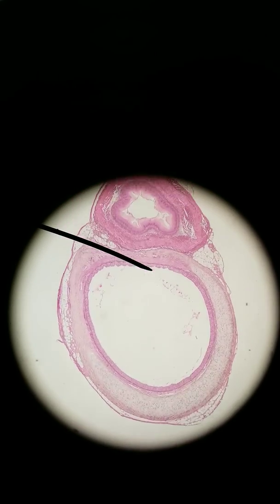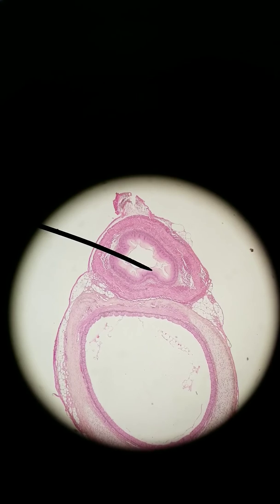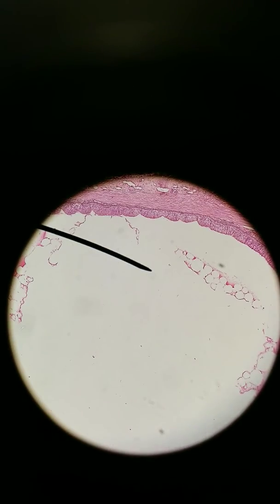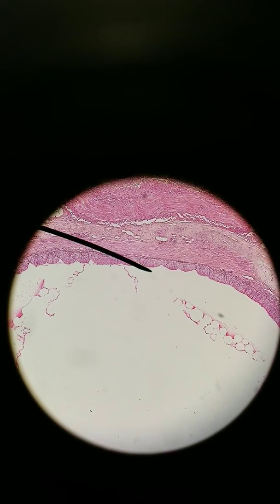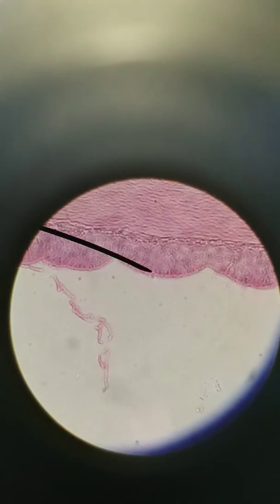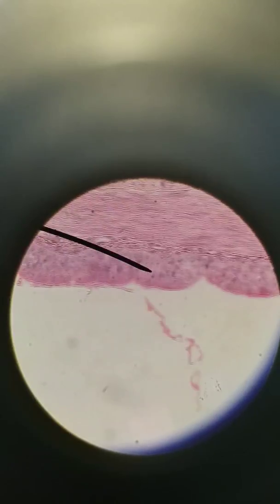But they both are lined with epithelial tissue. How do I know what epithelial tissue looks like? One hallmark of epithelial tissue is its cellularity. That means lots of cells are packed together. What we saw in connective tissue is that the nuclei were pretty far apart because the cells were far apart. You had lots of extracellular matrix in between. Going to 400x, with the cellularity of epithelial tissue, we can see that there's a lot of nuclei bunched together.